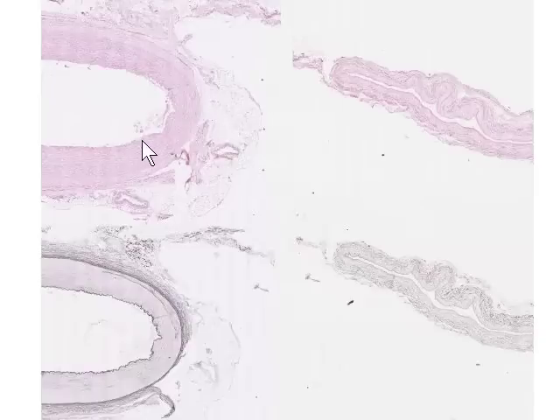The tunica intima will be on the luminal surface somewhere here. The bulk of what we see here is the tunica media, which will be made up of circumferentially oriented smooth muscle, and the material which we see out here is connective tissue, which forms the tunica adventitia. Clearly it should be evident to you that the largest of the layers of the wall of an artery is the tunica media. Over here we see an equivalent vein that would accompany this.